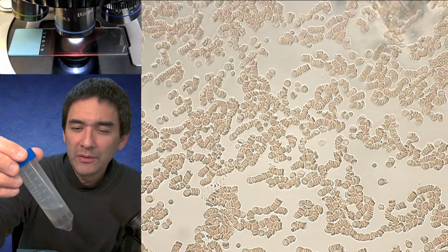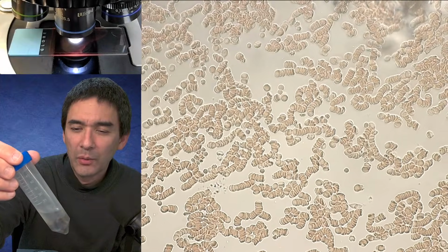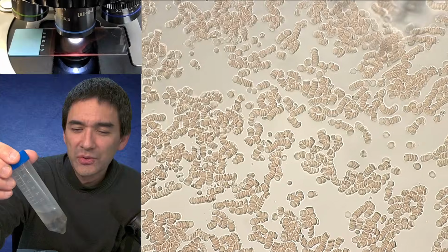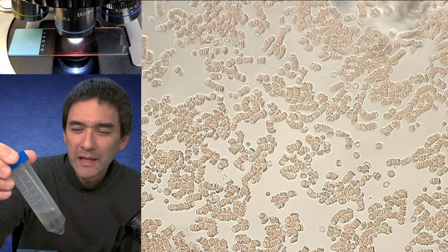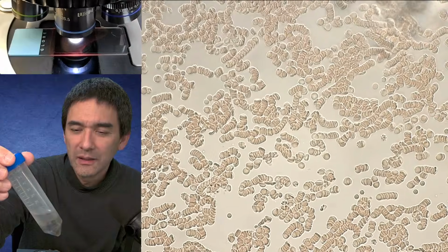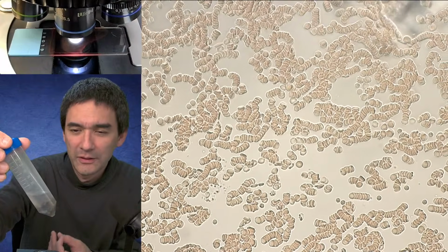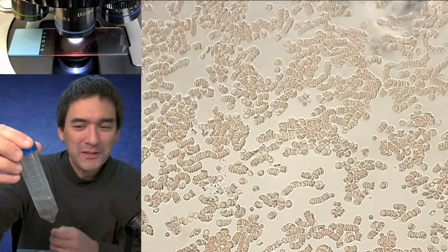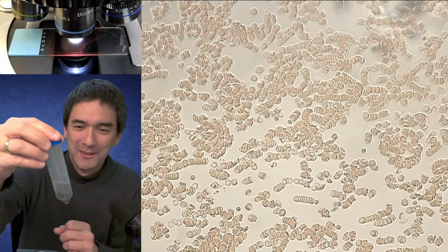Pulling it out and having the whole pin go into your finger is crazy to us who use those pens regularly. Pulling it out. Okay, did it go in too far a little bit? Okay. I'm not using this regularly. It was actually the second time that I tried it today.